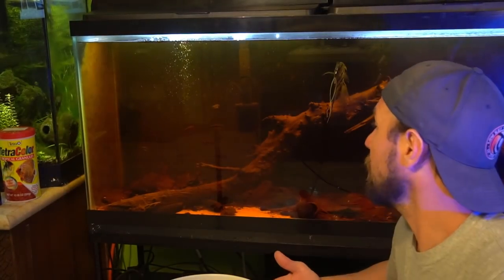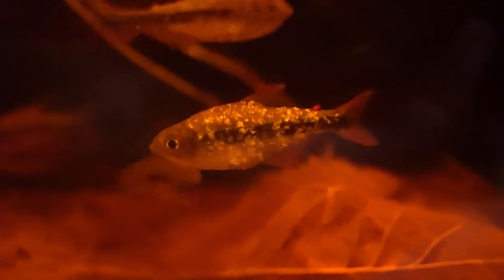I want to go ahead and pull out one of the very heavily infected fish and get a culture sample of this parasite off of the skin, off of the outside, without really damaging the fish too much. Get that under the microscope and we'll take a look at it. I don't want to bore you guys with the process of me catching one of these fish. I'm going to get that done, get the fish over to the table, scrape a culture, get it back in the water, and then we'll check it out on the microscope.